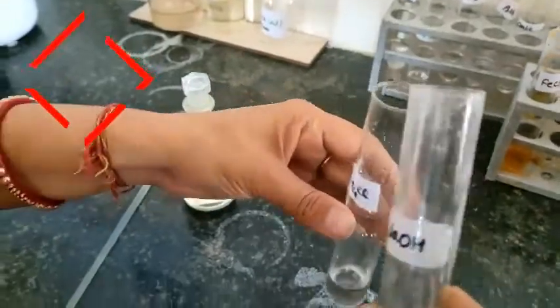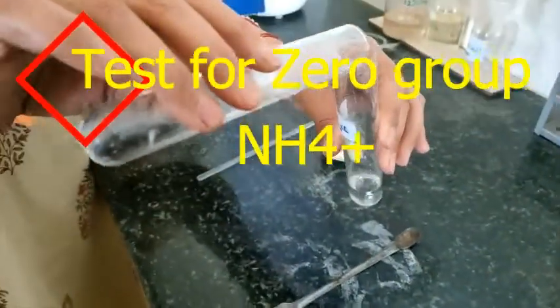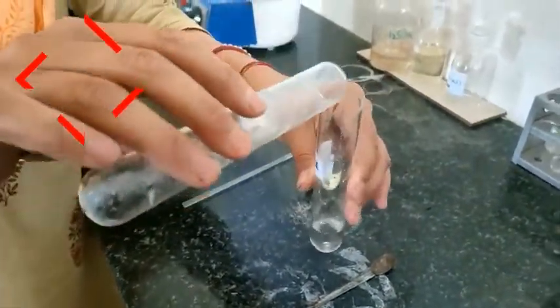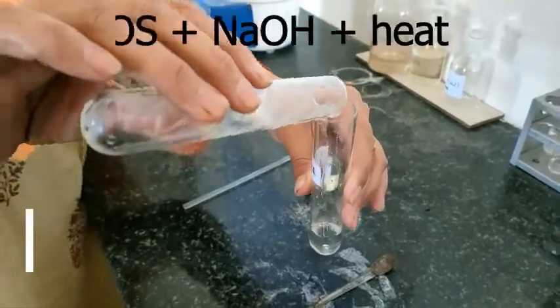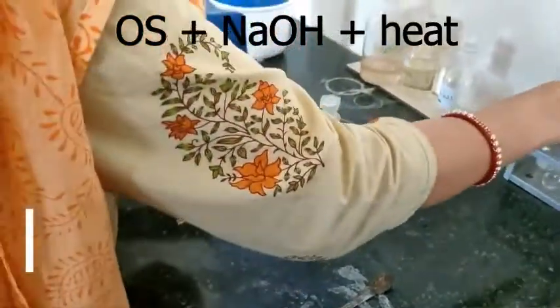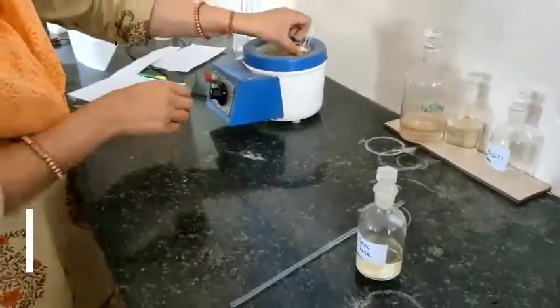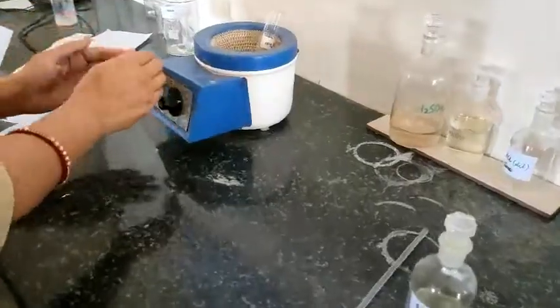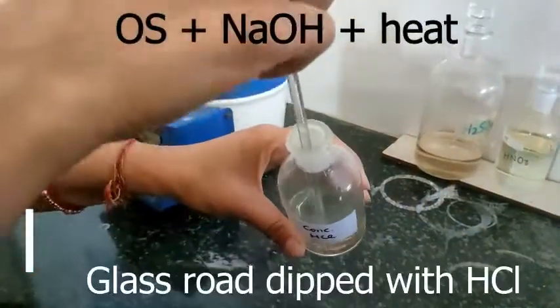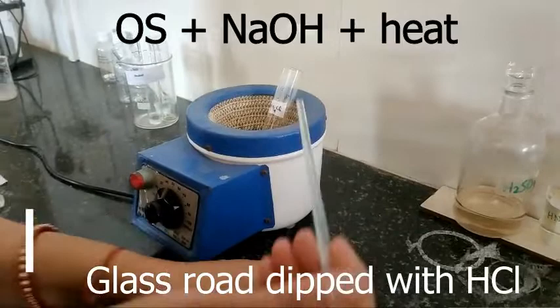We are first going to test the zero group, and in this group, ammonia is the only basic radical. I have taken the original solution and added NaOH solution, then kept this in the heating mantle for heating.